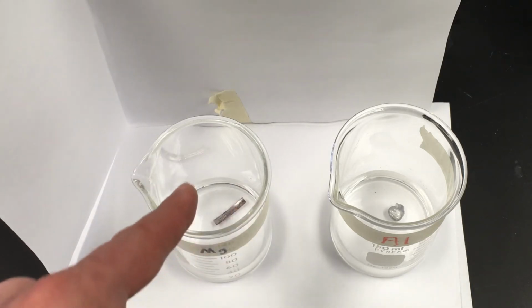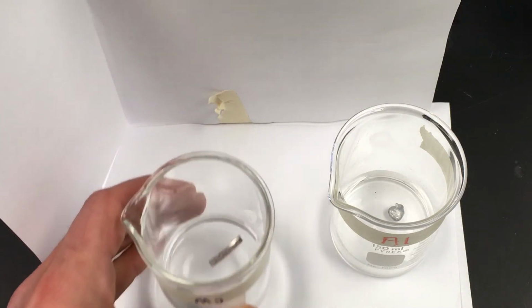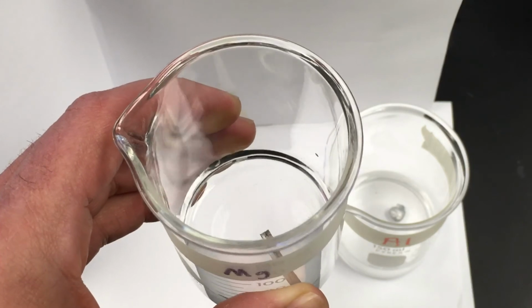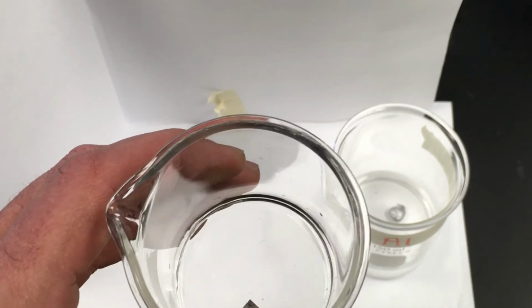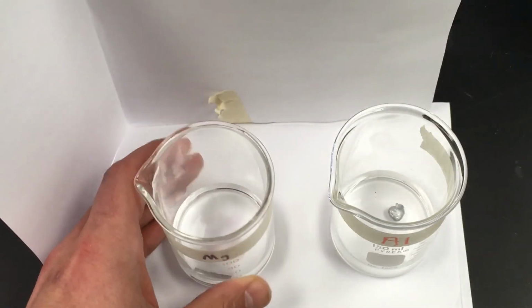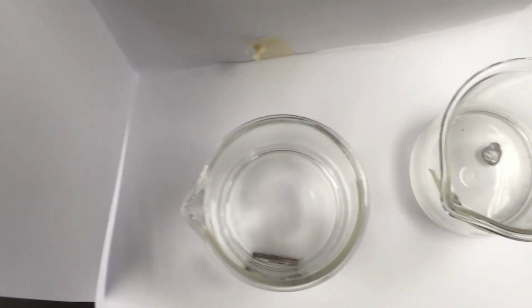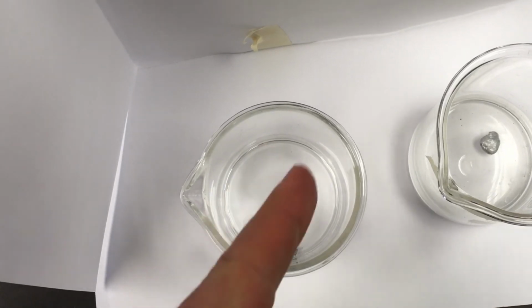All right, so if you're looking here, you can see a little bit of bubbling there. See a couple little tiny bubbles? Aw, how cute. So it's reacting very slowly. And there's a very, very faint pink color. It's really hard to see. But that's why I put it on top of white paper. All right, so there you go. There's magnesium. See that very faint pink color there in the middle? It's really hard to see, but it's there, right in this middle area.